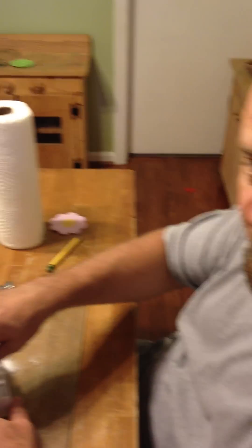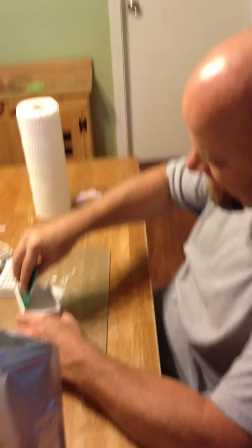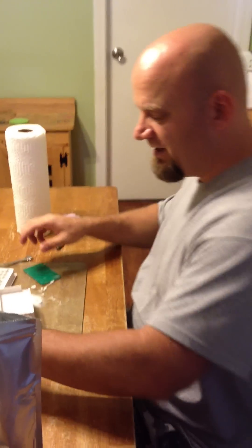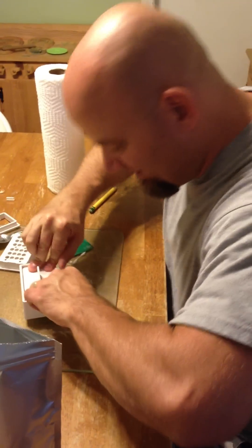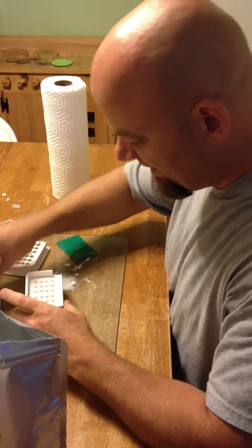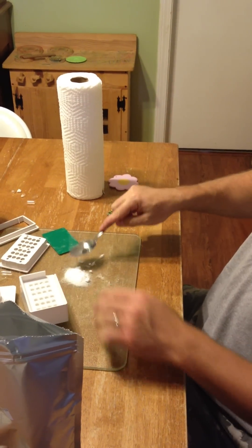We have a little monster in our closet that won't quit making noise. What you do — if you can see this — you should just tamp it down to pack in the Piracetam.